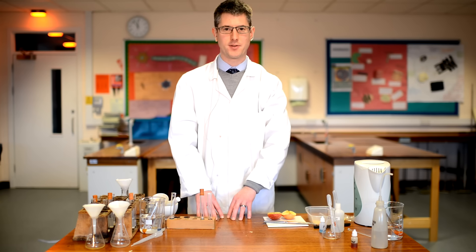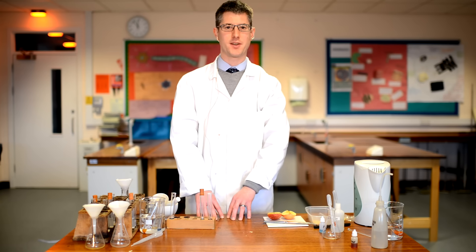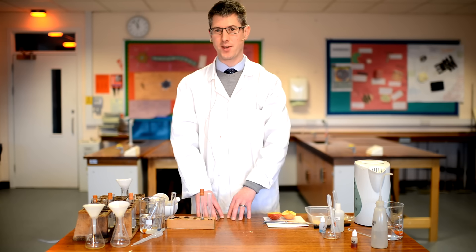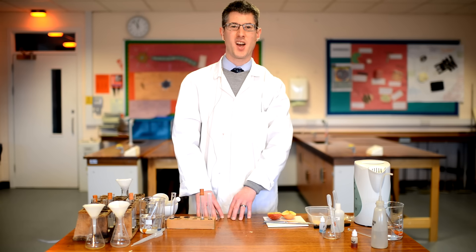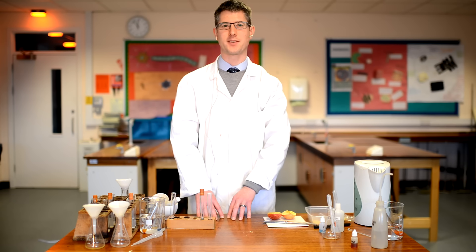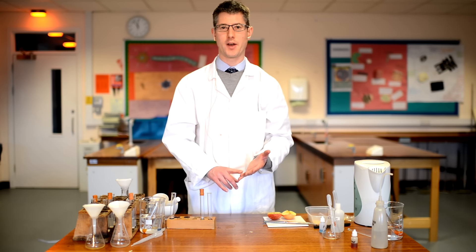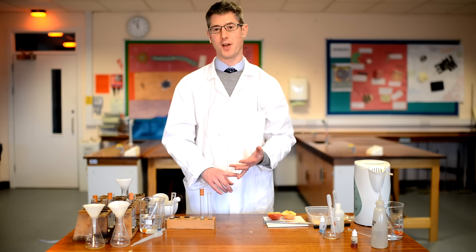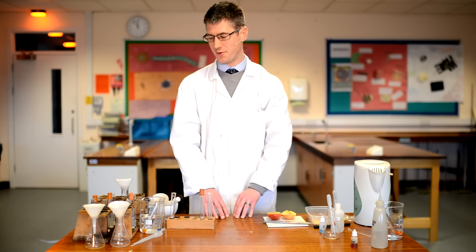You need to know the methods and techniques we've done there — the chemicals you've added, the starting colour, and anything else like adding heat that you've done in the method. Equally important is knowing the colour changes you should see for a positive test for those different types of food: a positive test for glucose (a small carbohydrate), for starch (a large carbohydrate), for lipids or fats, and for protein.